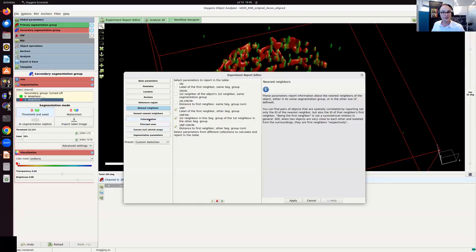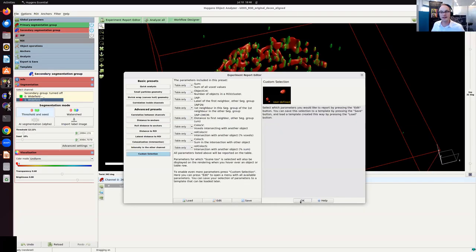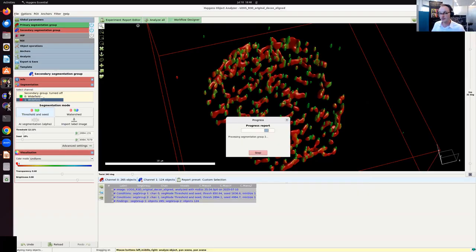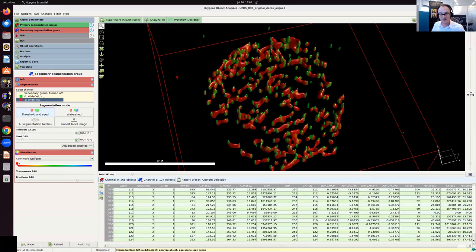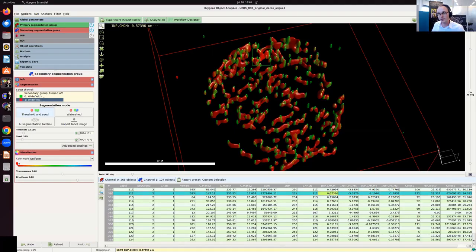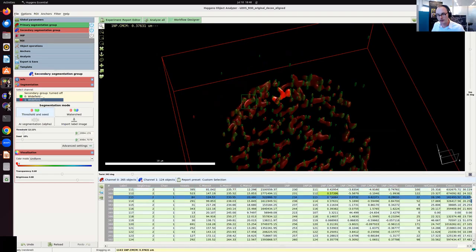And same for the co-localization. These are the co-localization measures that I want right now. Okay, so I just click apply, and then I click OK. And now I've set what I want to analyze, and I run it to get the data that I want. So you find a lot of different parameters here. And the one that we're interested in right now is this one. So it's the nearest neighbor, center of mass distance.